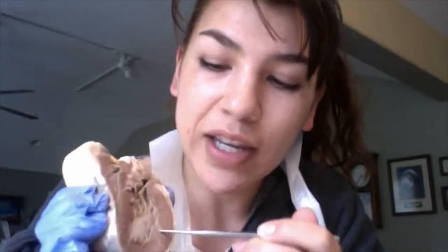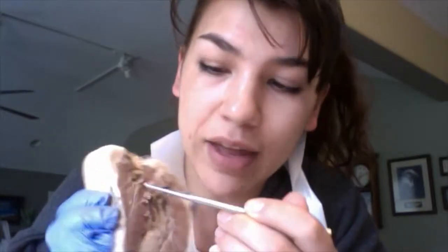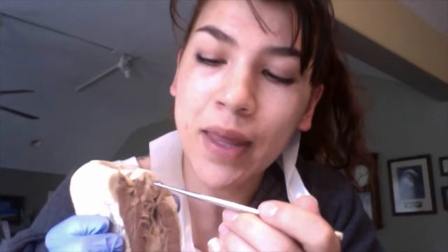The myocardium of the left ventricle is almost 3 times the width of that of the right ventricle. And that is because the left ventricle is responsible for pumping the blood up out through the aorta to supply the rest of the body. And this action requires considerably more strength and power, which is why the walls of the myocardium on the left side are considerably thicker than that of the right side.